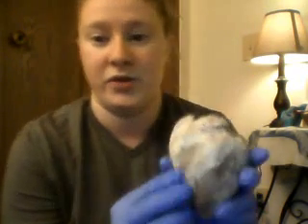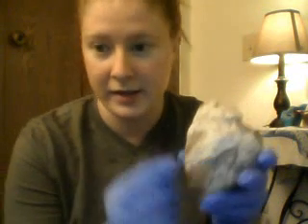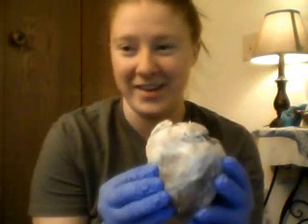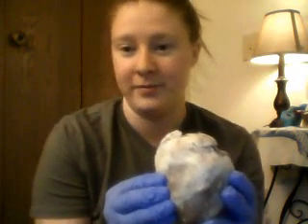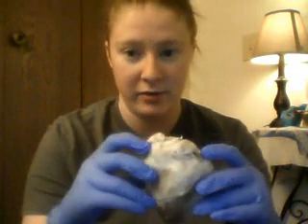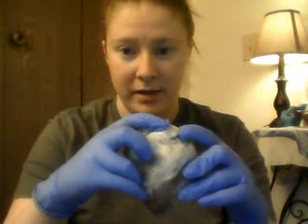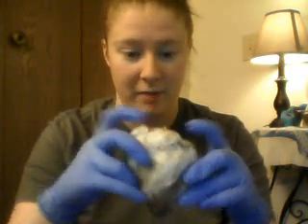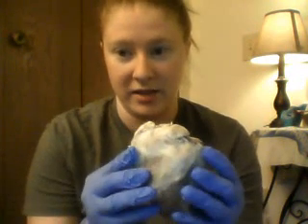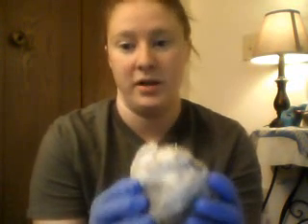And we have the interventricular sulcus, which is this groove here, and in it is the posterior interventricular artery and the middle cardiac vein. And then the pulmonary trunk originates in the right ventricle over here, and it leads to the right and left pulmonary arteries that come up here. So the blood that's in this vessel is going to the lungs, and the blood is deoxygenated.